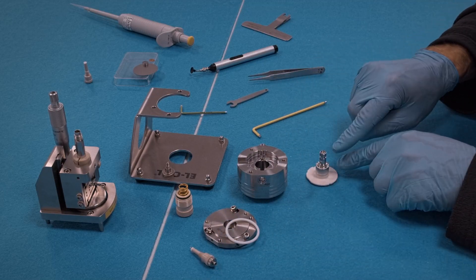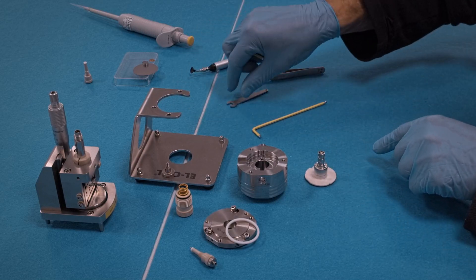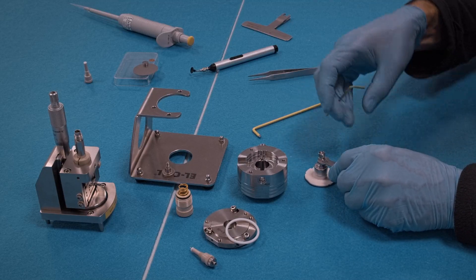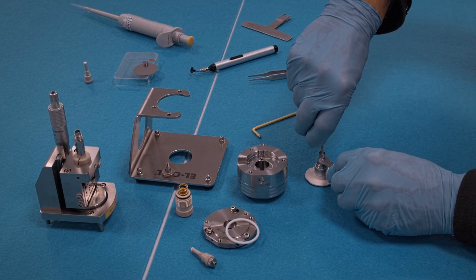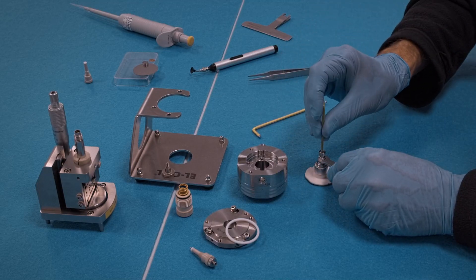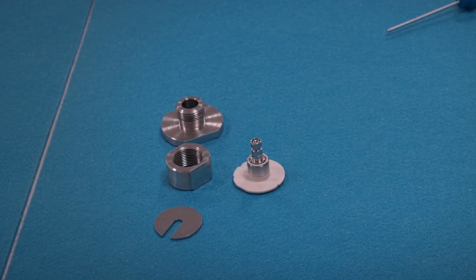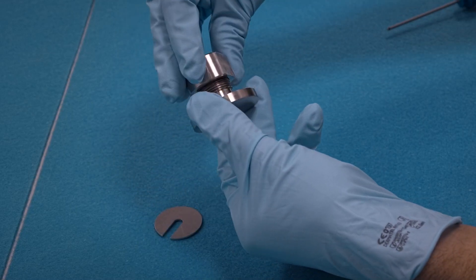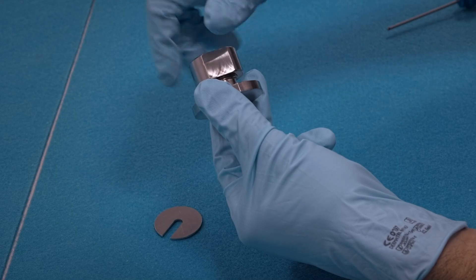We first need to release the center screw. Use a 7mm wrench to prevent turning of the piston, and loosen the screw but don't completely disassemble the piston. The piston sticks firmly in the flange, so we have this little tool here for removal of the piston.